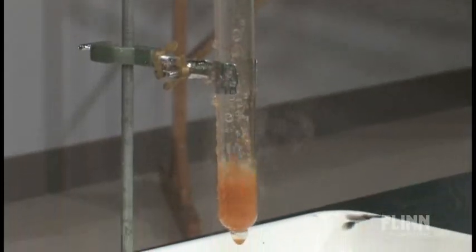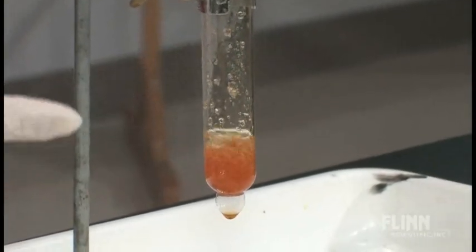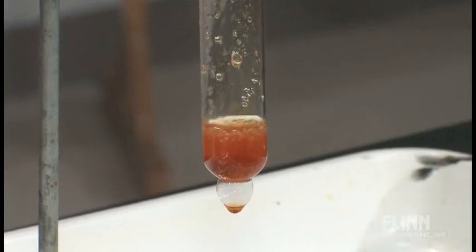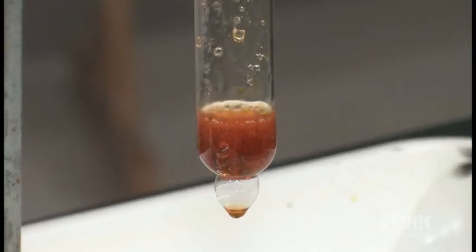And so the reaction will foam over again. And again, after the reaction is finished, we go back to that yellow color that we saw, that yellow orange color that we saw for iron chloride.